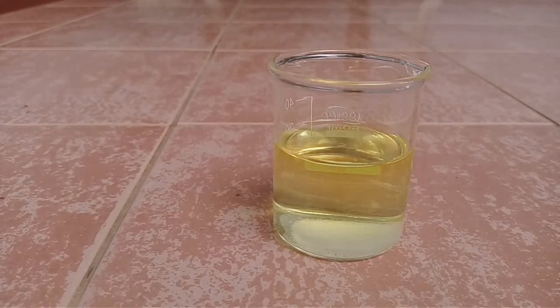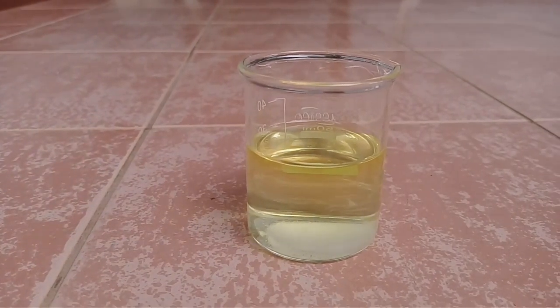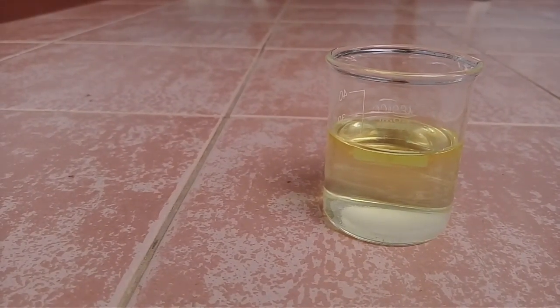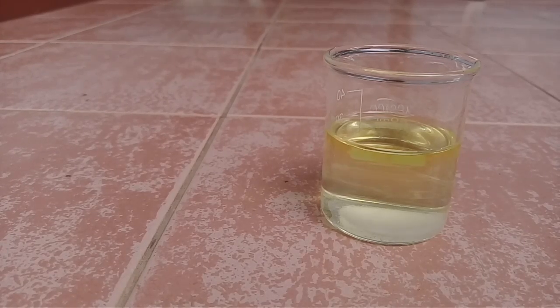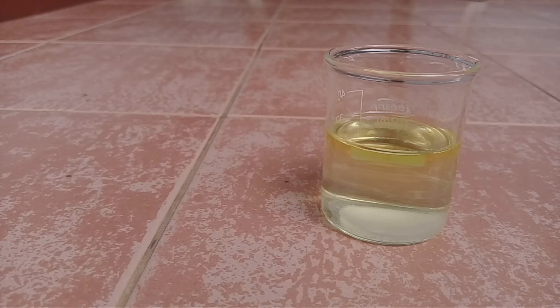Now you can see here the gold color solution turns to colorless solution. After a few minutes we can see here the gold particles precipitate out.